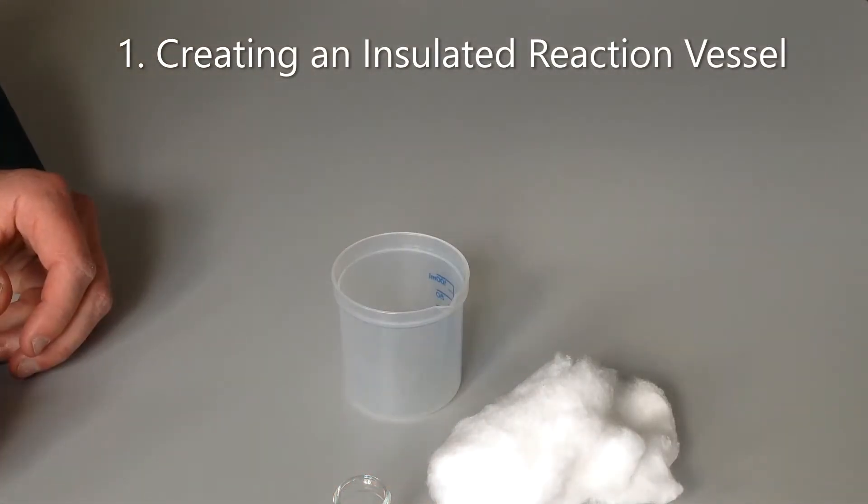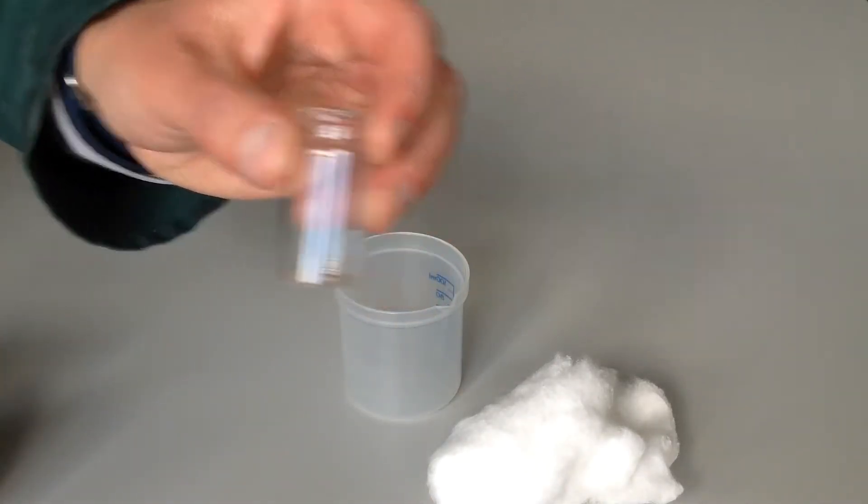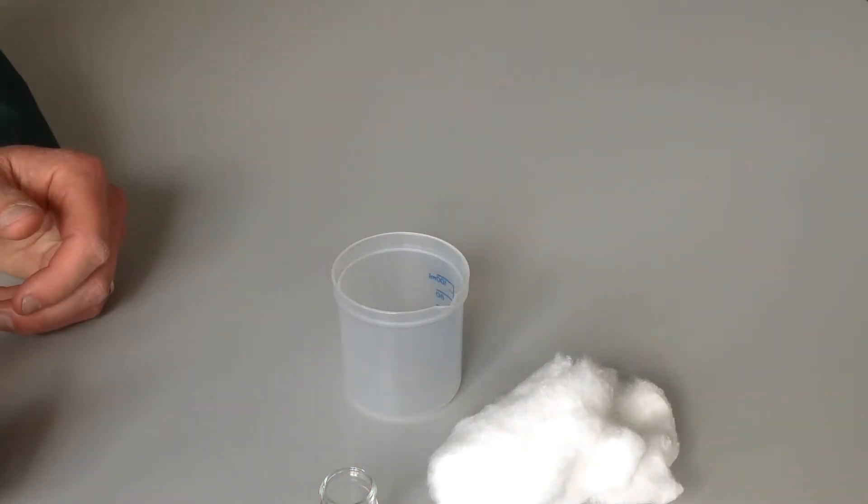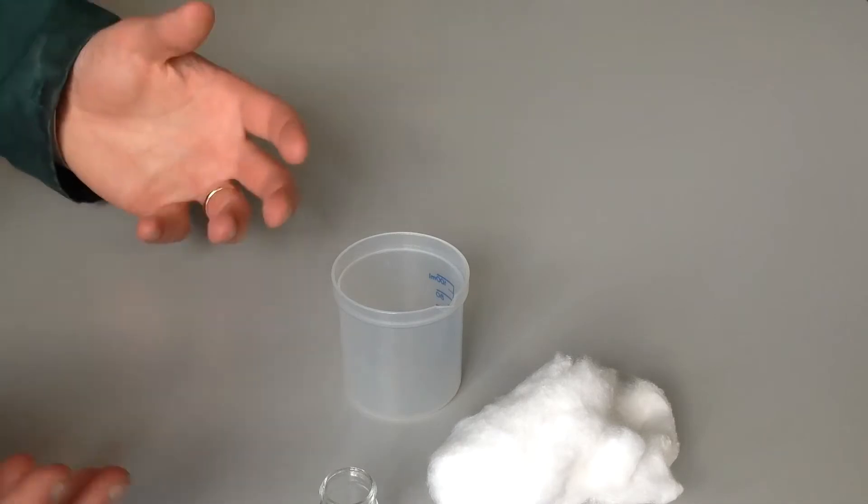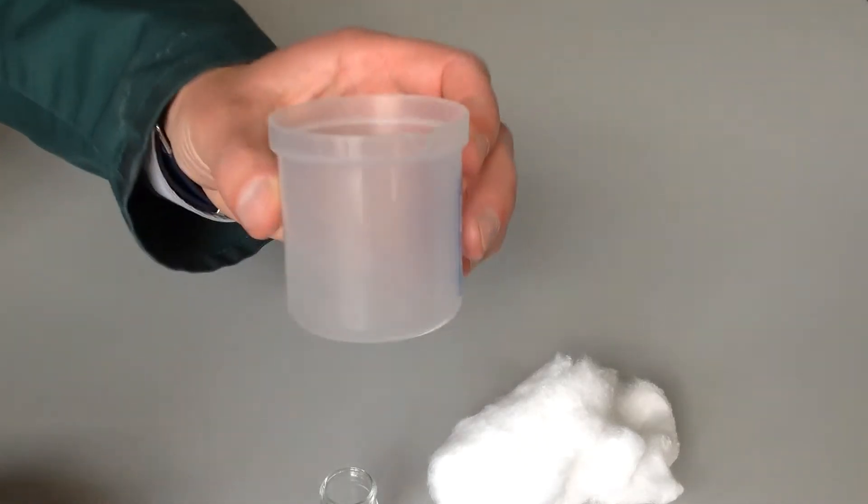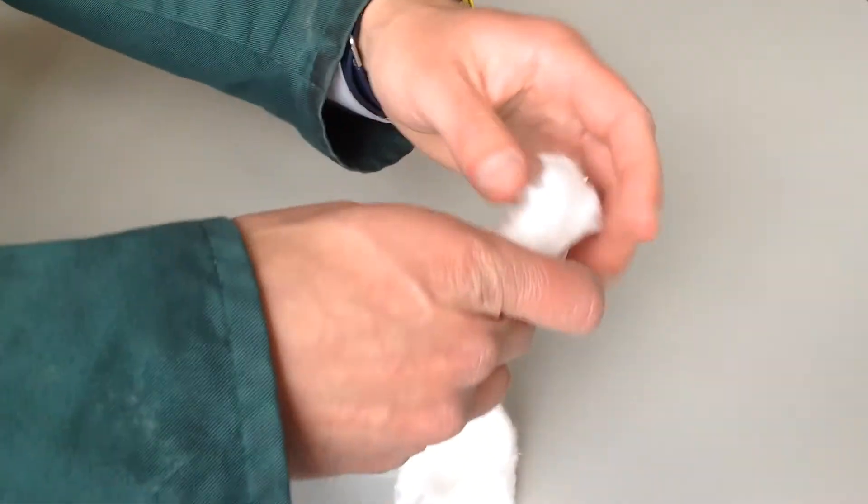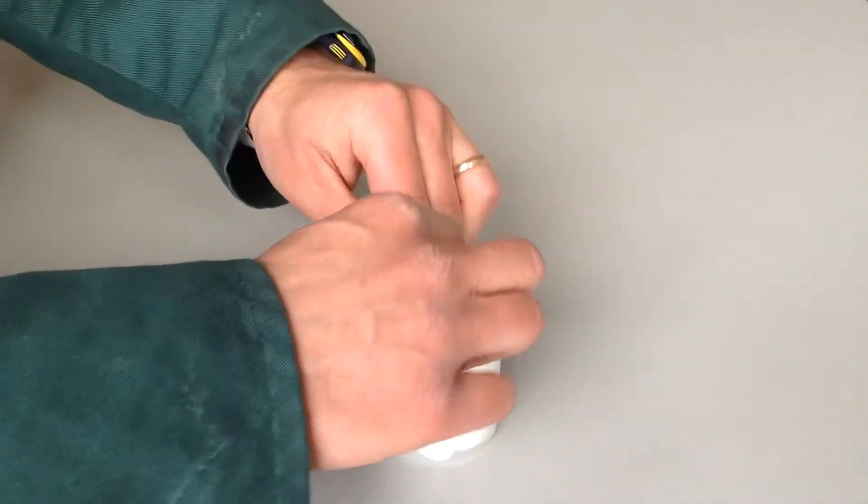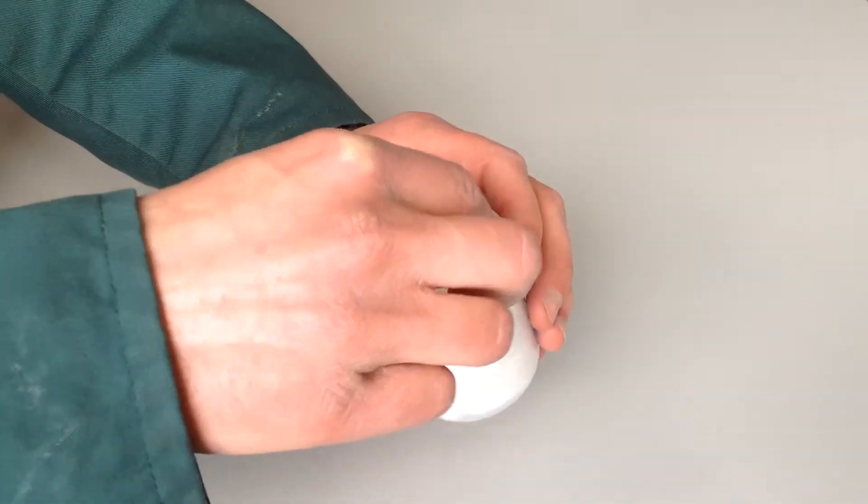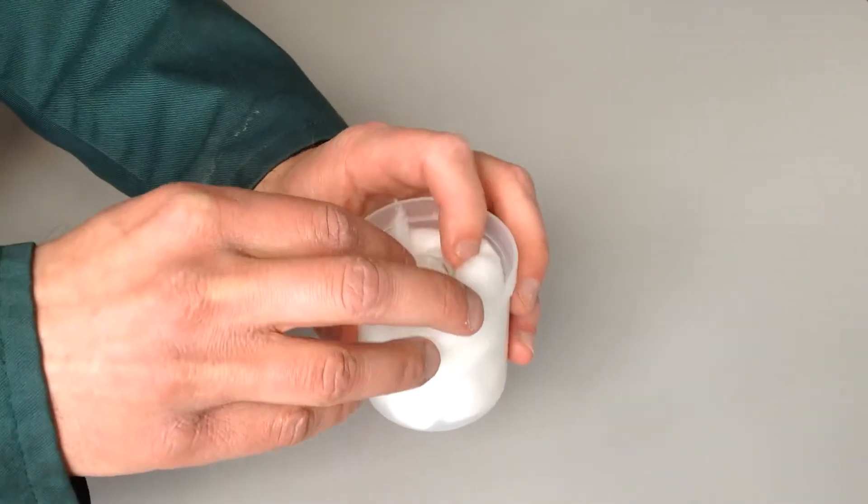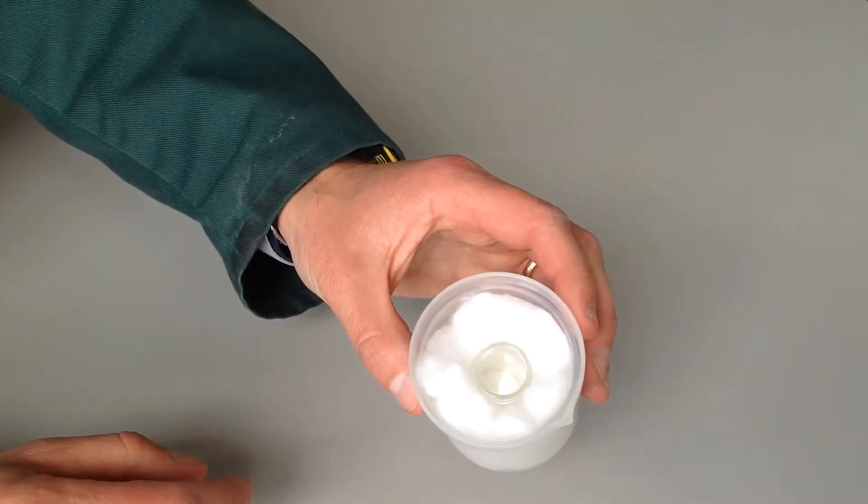In order to make this experiment quicker and the waste disposal better, we're going to carry out our experiments in glass vials which look like this. Now the glass by itself is a fairly good conductor of heat, so that's not going to give us very accurate results. So what we're going to do is provide some insulation around it, or lagging as it's called. We've got these plastic beakers and we're just going to fill those up with a bit of cotton wool. You're just going to create, with a few pieces of cotton wool, a vial-sized hole in the middle. Just put an empty vial in there, tuck it in nicely. You don't need to pack it in too tightly, and that is what your reaction vessel should look like.